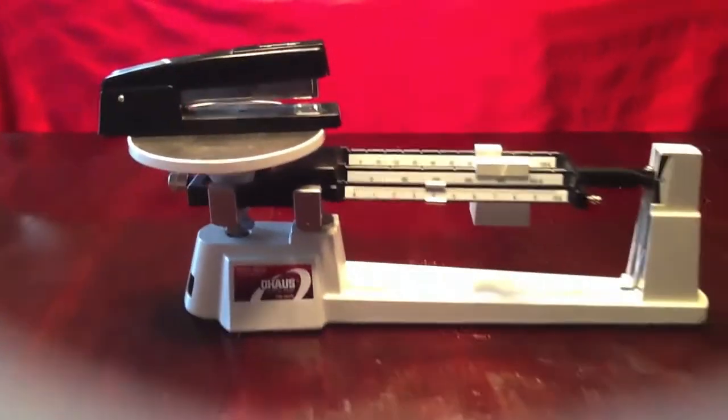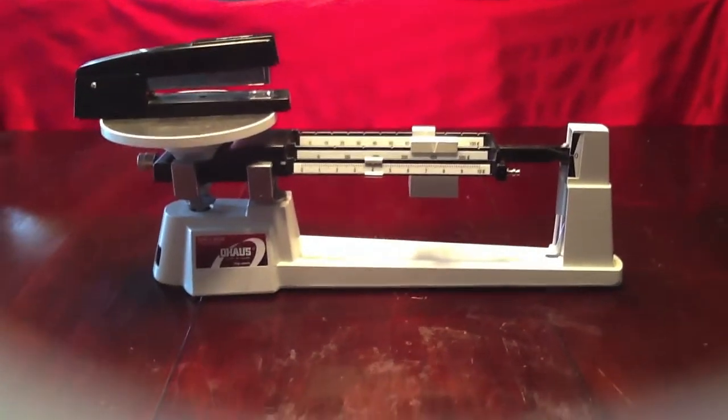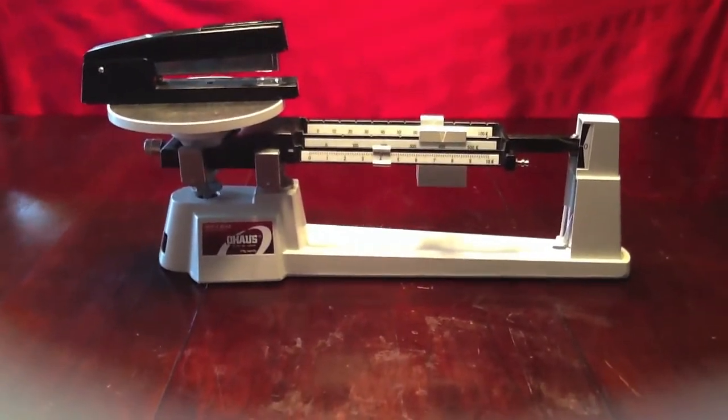And that's how we can accurately use a triple beam balance to measure the mass of an object.